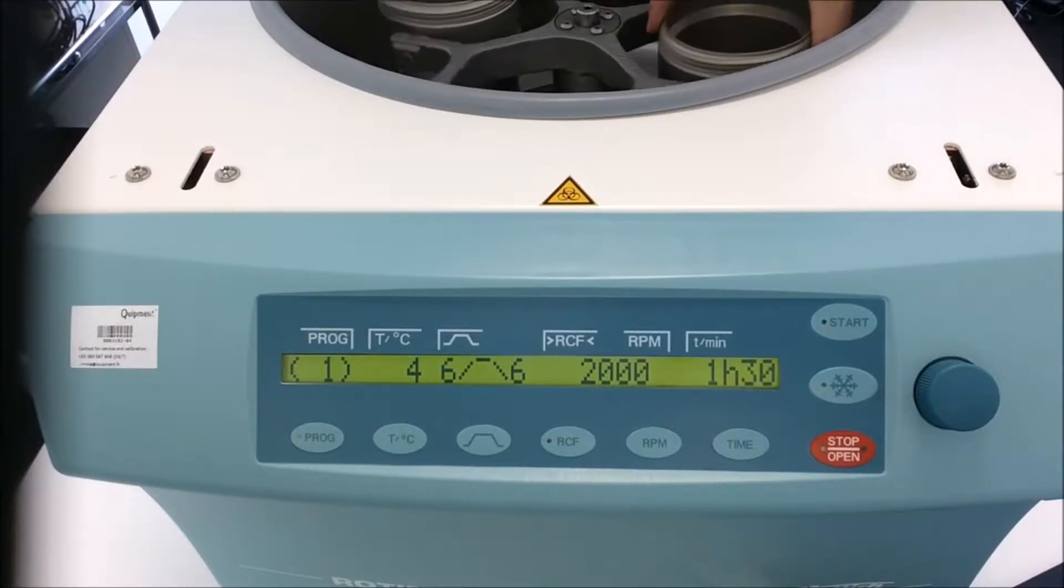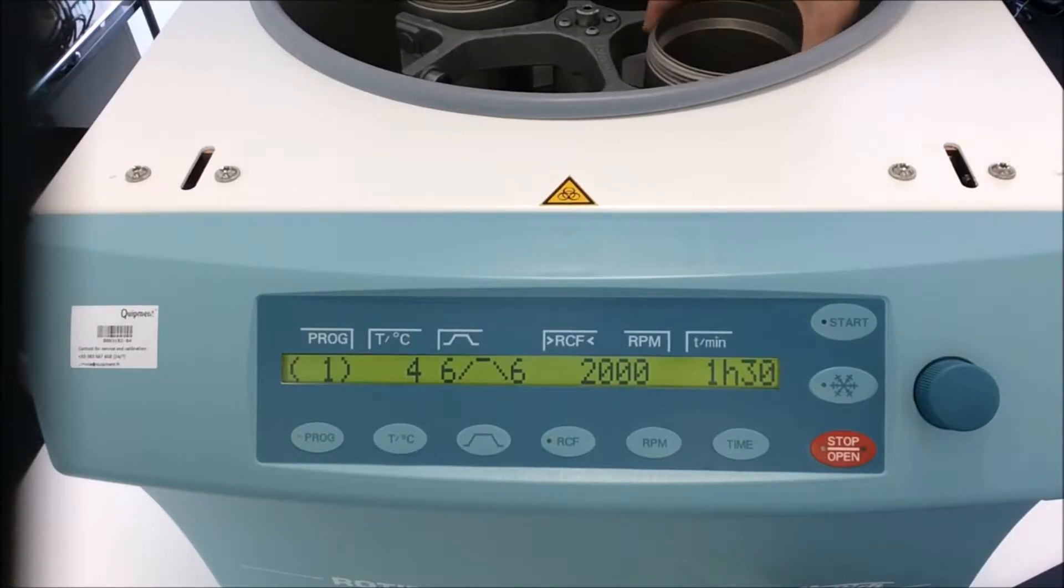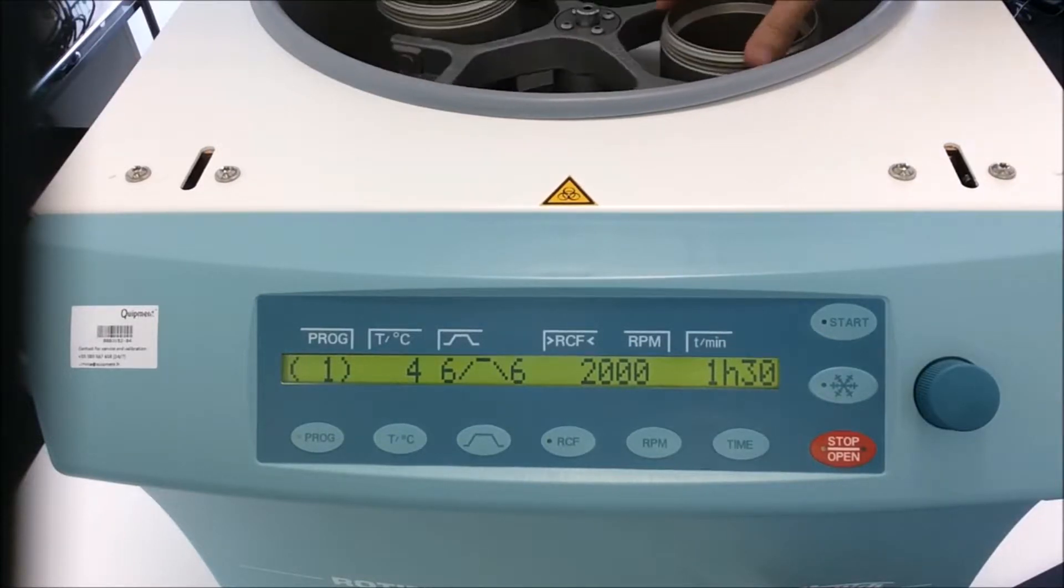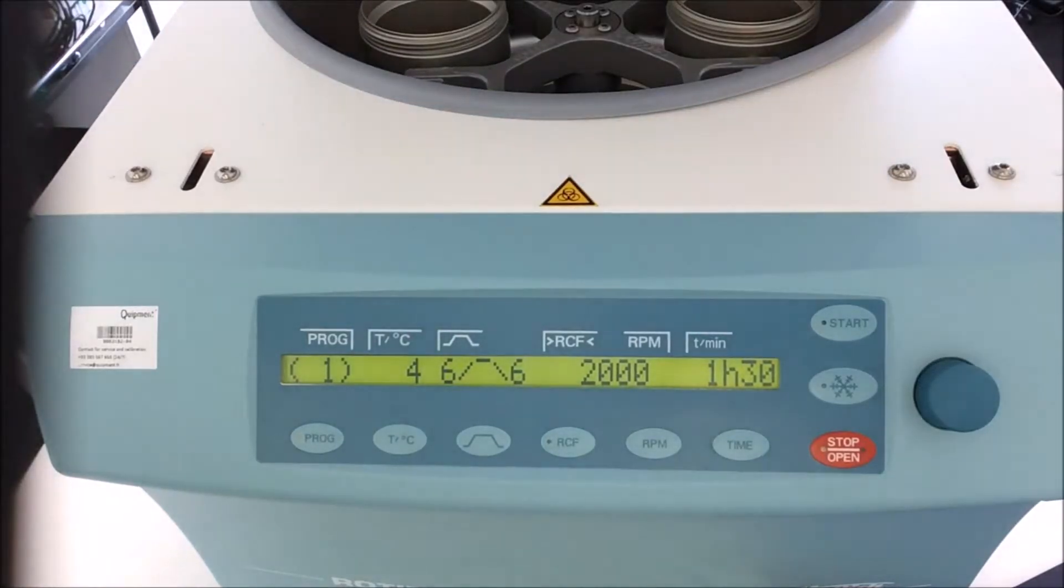Let's imagine that we can insert my samples in the bucket and adapters. Once done, I close the lid.